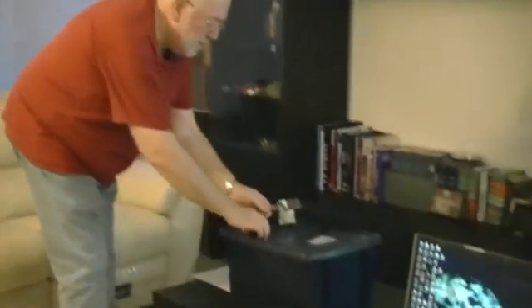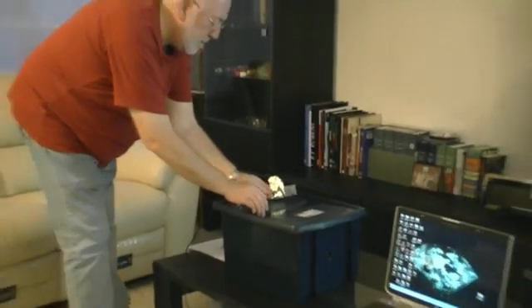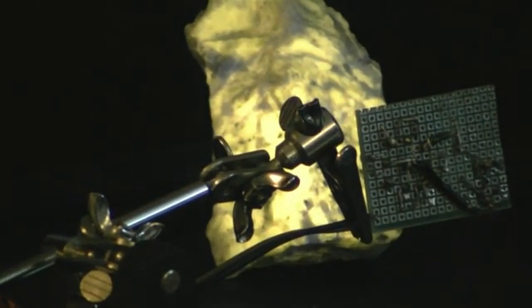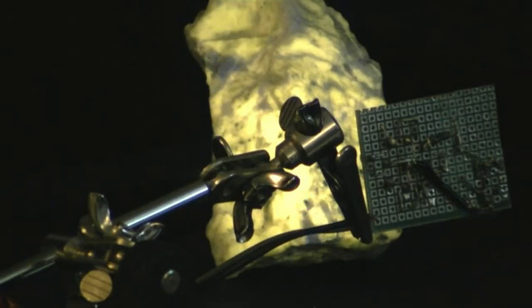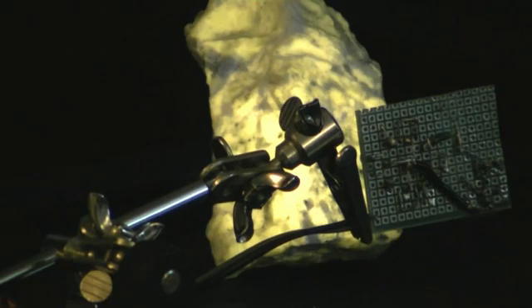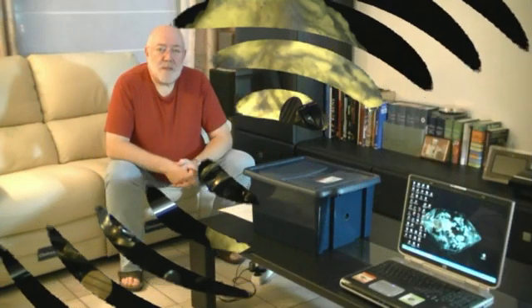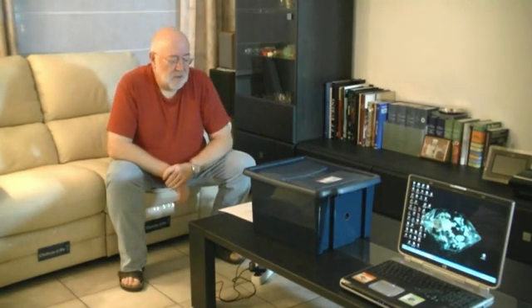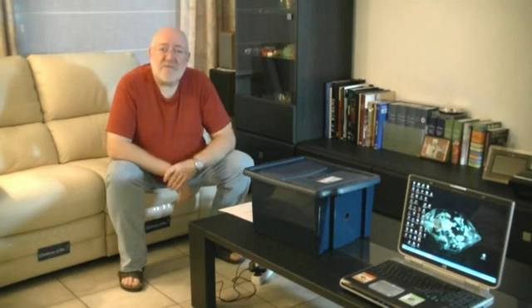I'm going to aim this at one fluorescent rock. There you go, and immediately we see that the rock starts fluorescing rather fiercely. This is the emission we are going to measure with our Ocean Optics USB 4000 spectrometer. As a measuring cell, we use a very sophisticated device, often also referred to as a dark blue plastic box. I lined it with black felt inside so there would be no internal reflections.